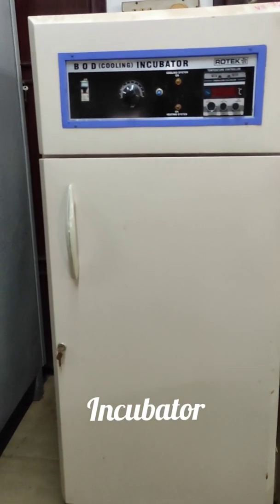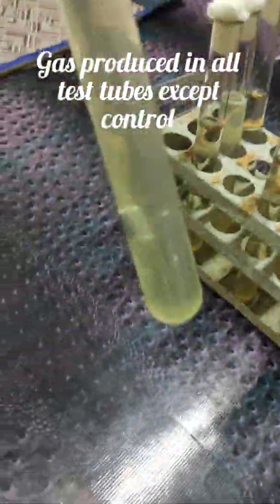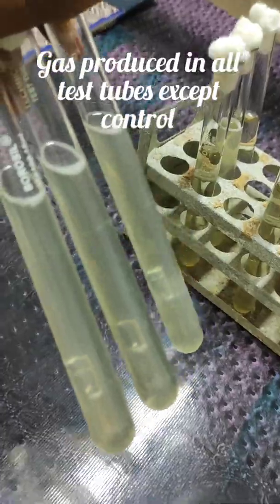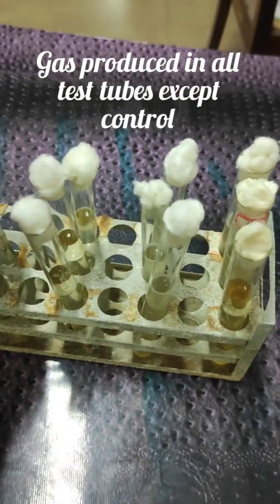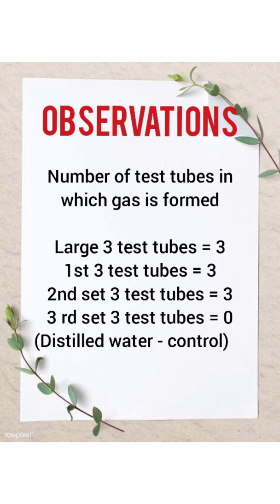Incubate the inoculated fermentation tubes at 35 degrees Celsius for 24 hours. After incubation, record the presence or absence of gas formation at each examination of the tubes, and note down the number of test tubes in which gas is formed.